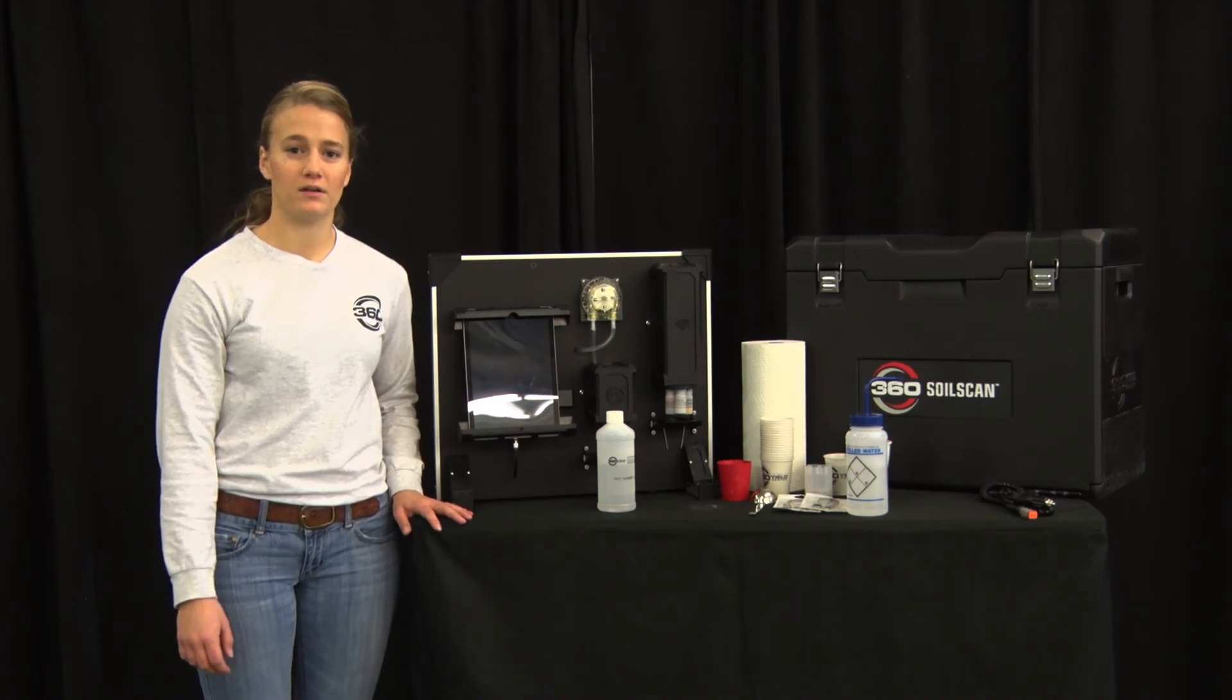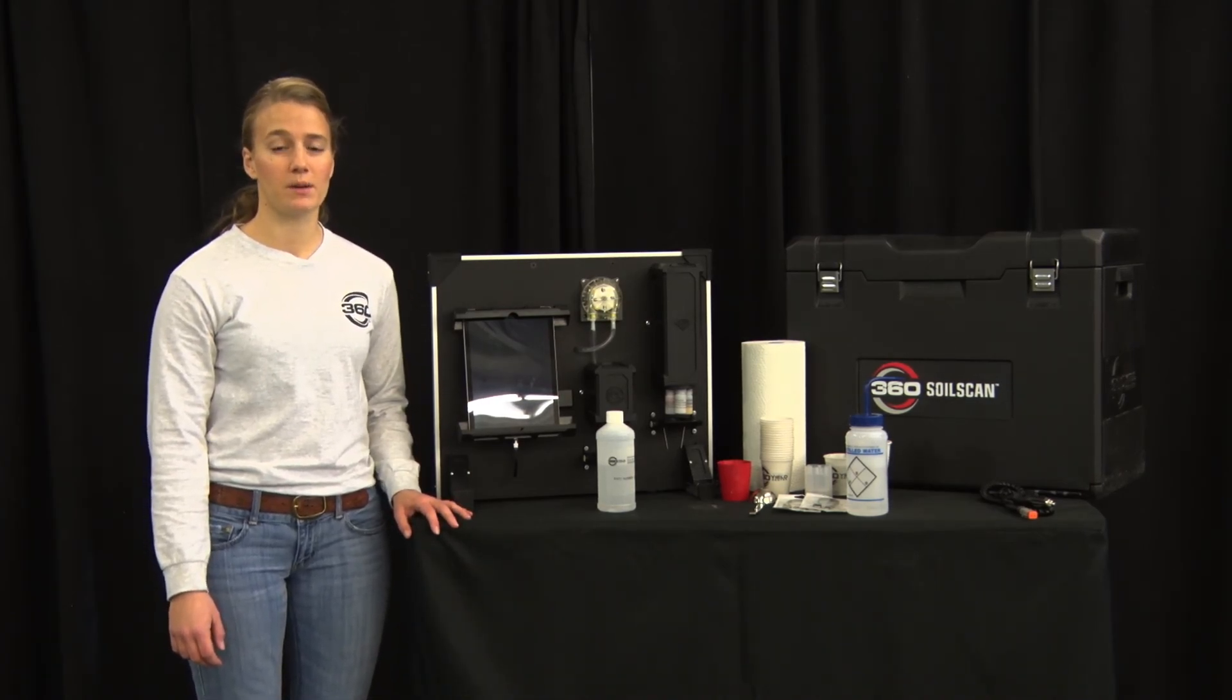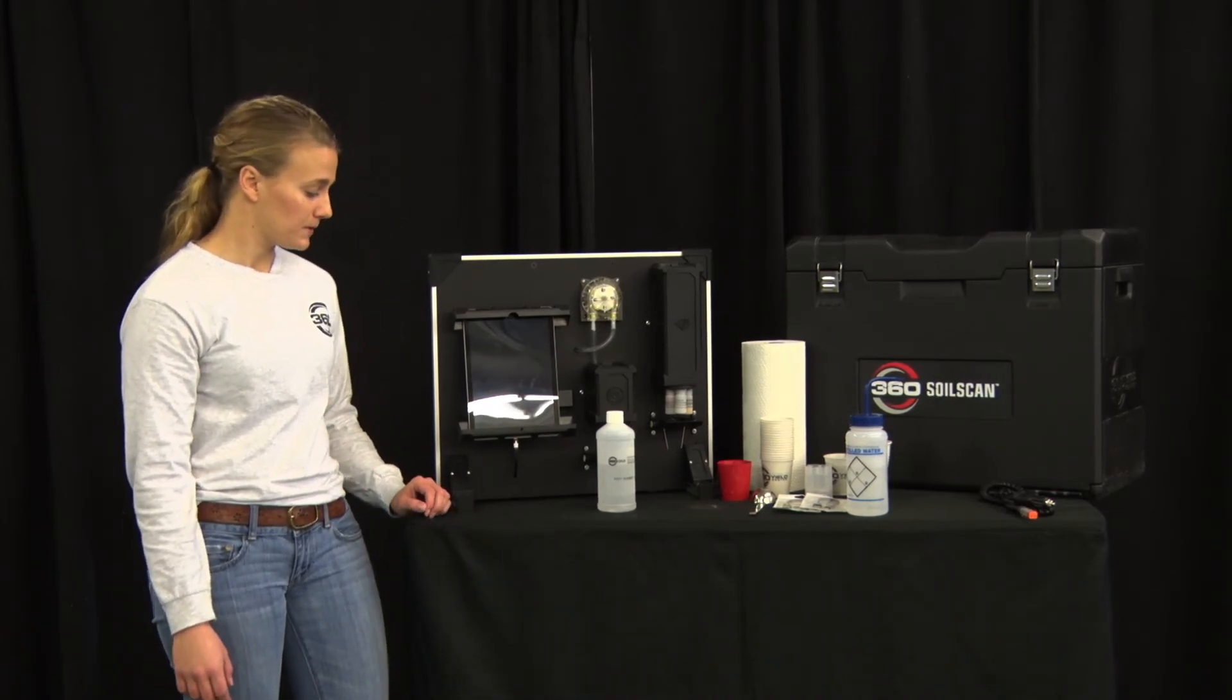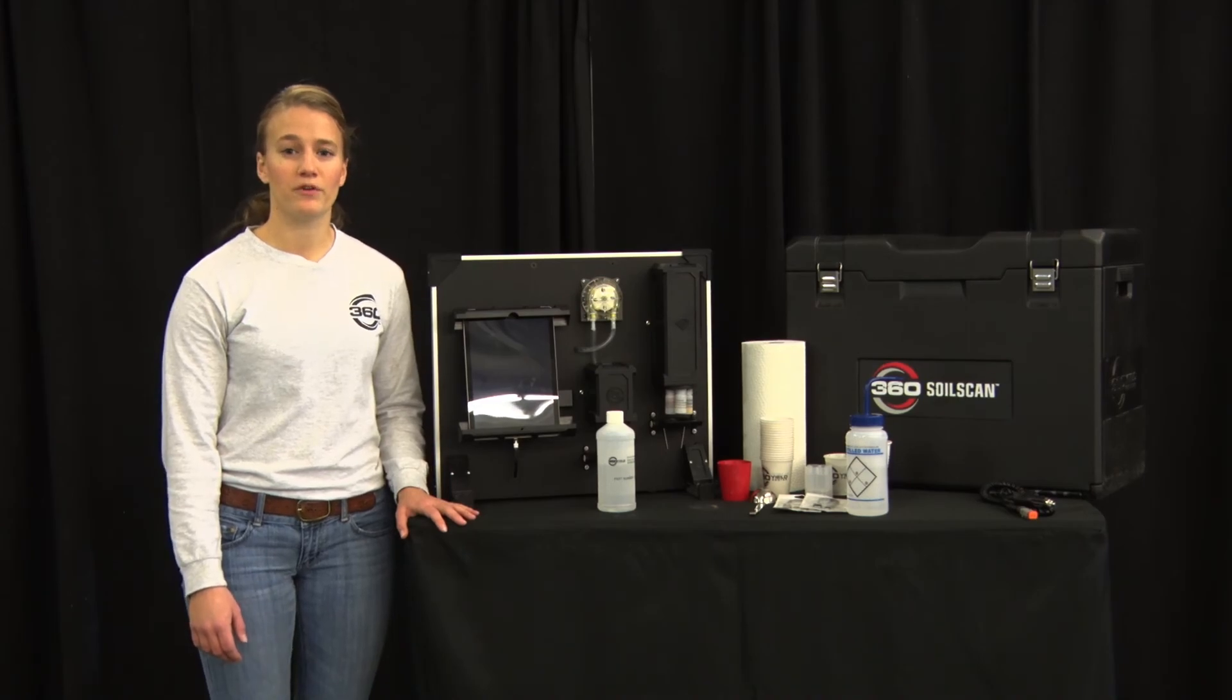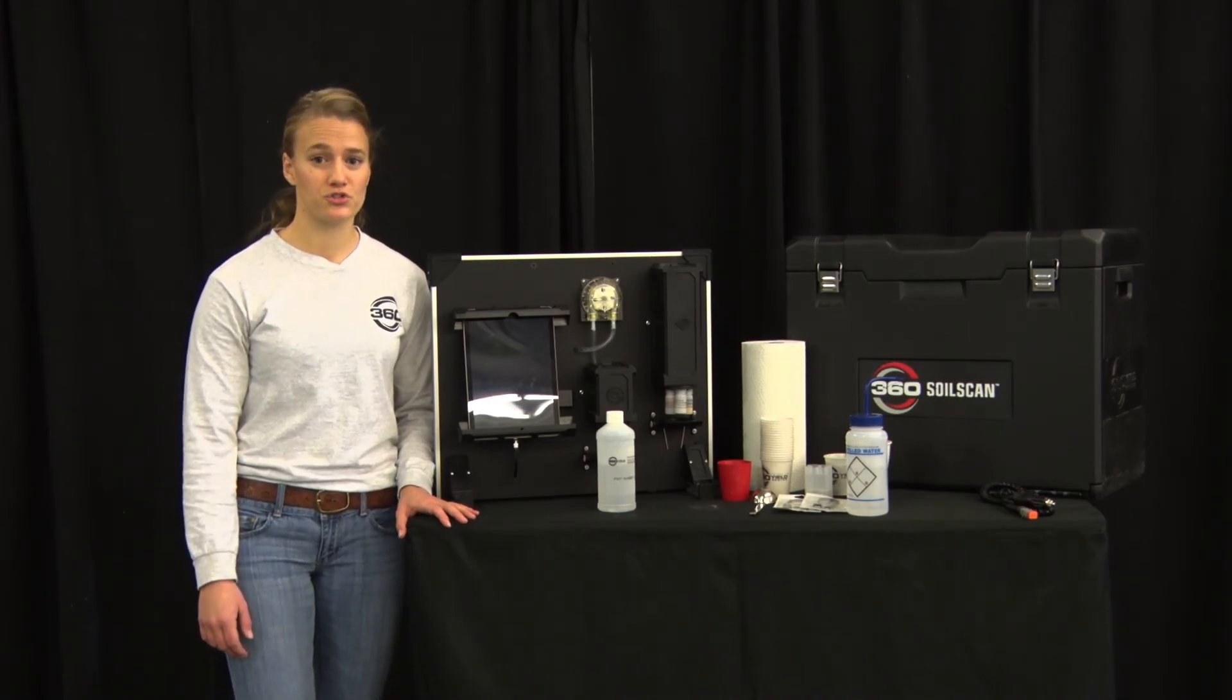When putting away your soil scan for long-term storage, such as over the winter, you want to ensure that it's stored in mild temperature room. 60 to 80 degrees is preferred. Also ensure to remove all the distilled water from the system and purge the pump. The pump can be stored dry.